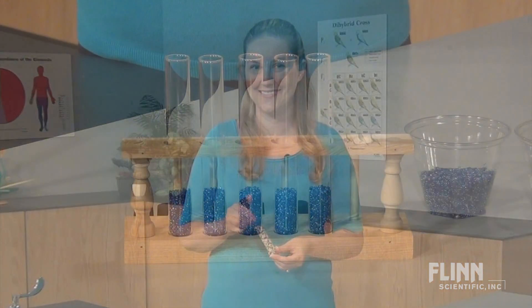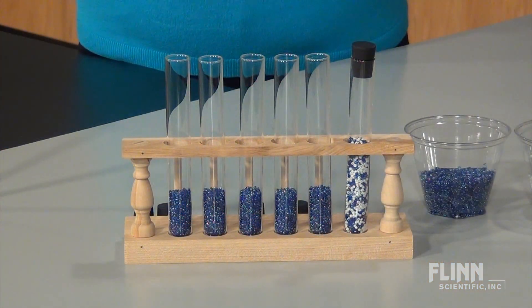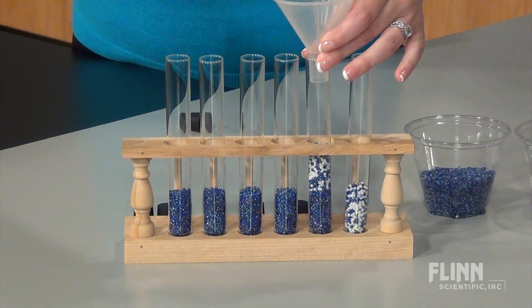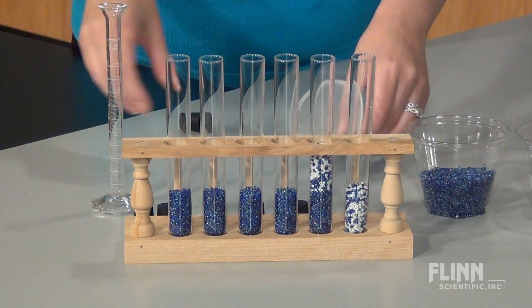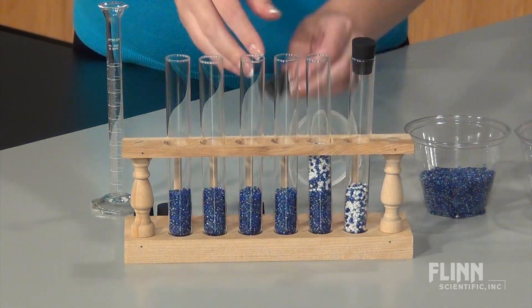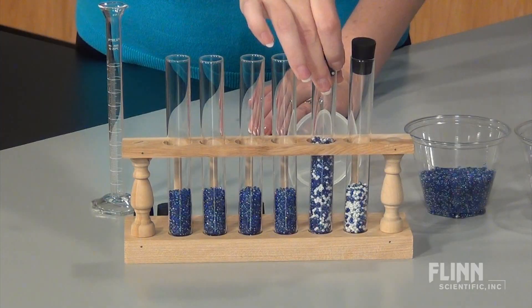This is a great opportunity to discuss the importance of mixing solutions to make them homogeneous. This first tube represents a 50 percent solution. Now transfer 10 milliliters from the first test tube, cap and mix well. This is the 25 percent solution.